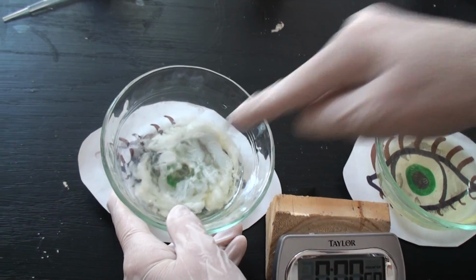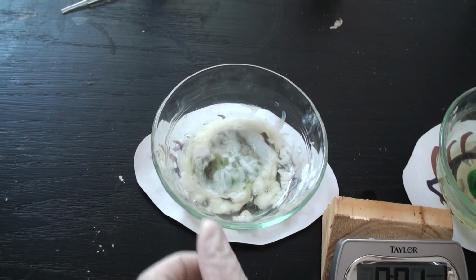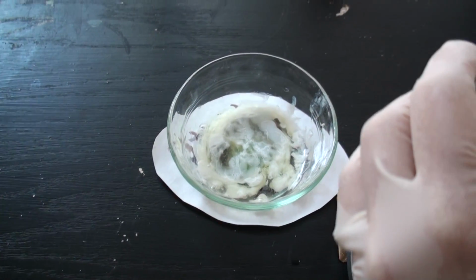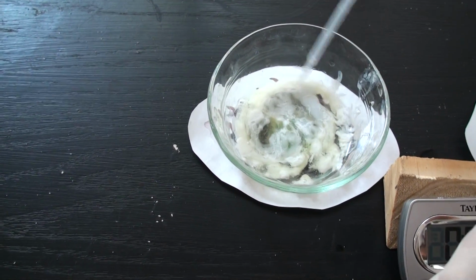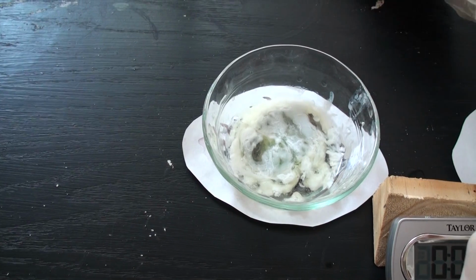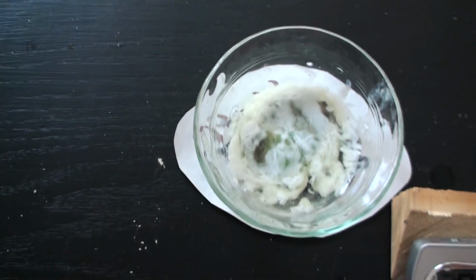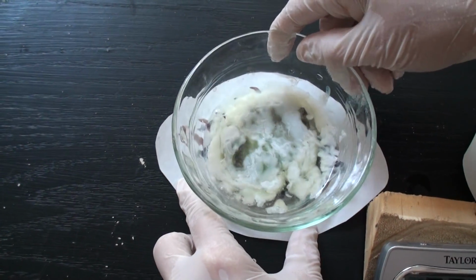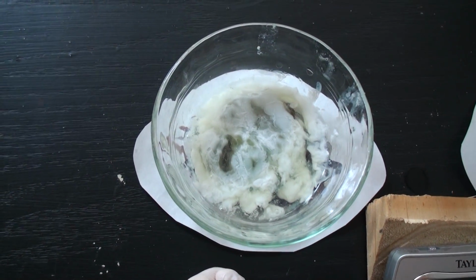Now this was an acid here that went in, and now we've got these little solid particles in here that are solid and chunky. So since it's an acid, our logic tells us, okay, if we have an acid, we can put a base in it and we can neutralize it. And it should go back the way it was, right? This is sodium hydroxide. It's a common base that you find in labs that you use. So we've added sodium hydroxide here at about 1:30 in. And you notice that the egg white is not going back.